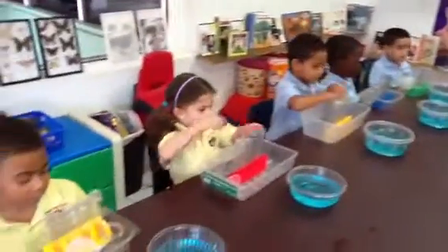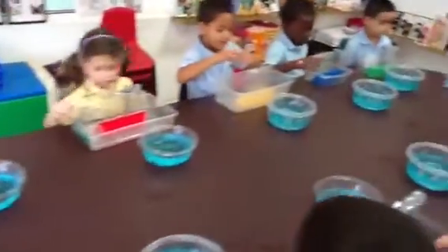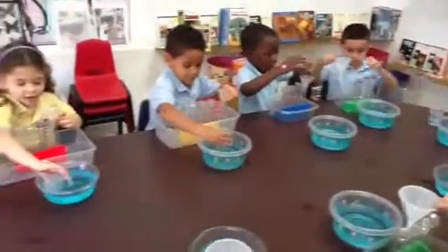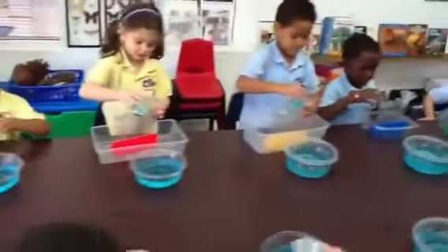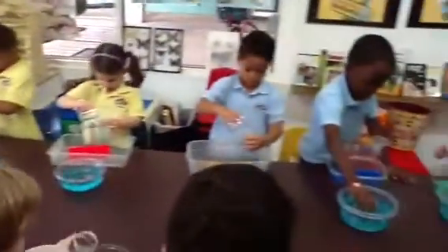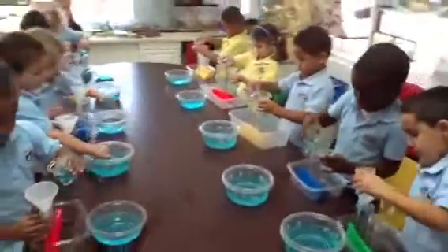Okay, I have four of them. You have four. So, what is this called? A funnel. This is a funnel. Take your funnel and put it in the first hole. If you want to stand up, it may be easier. Try not to let it go over — if it goes over, it's okay because it will spill into the container. Pour slow. Pour slow. Look, it's going over.